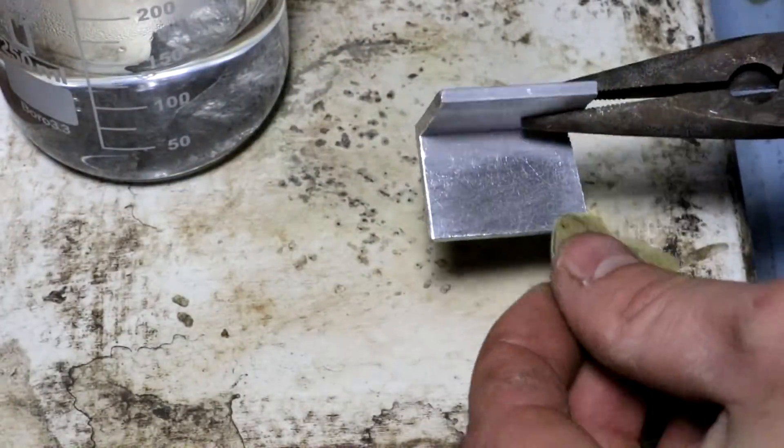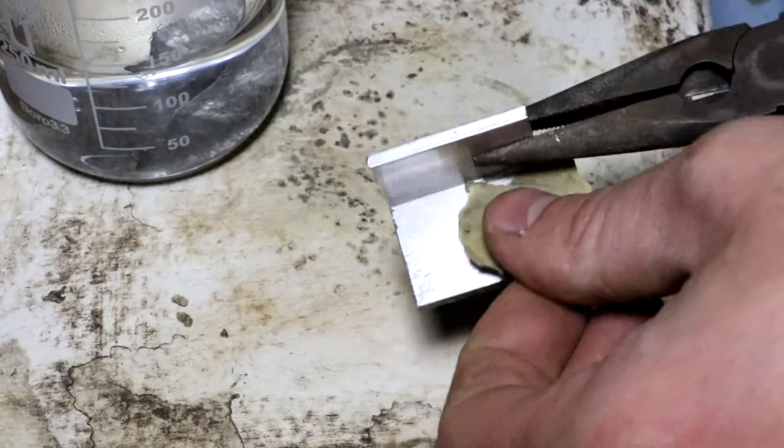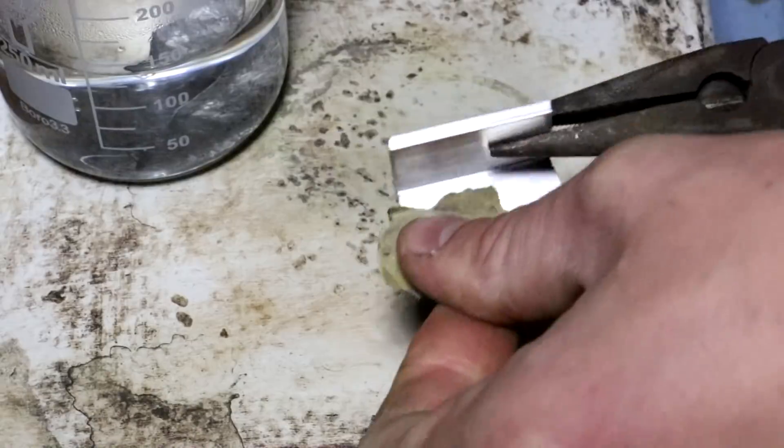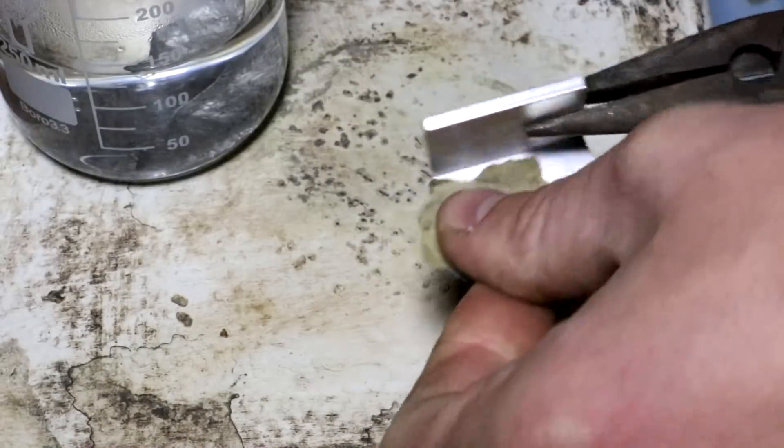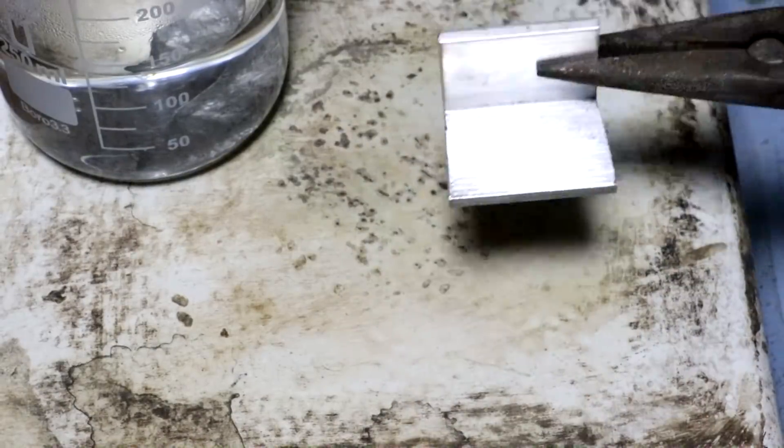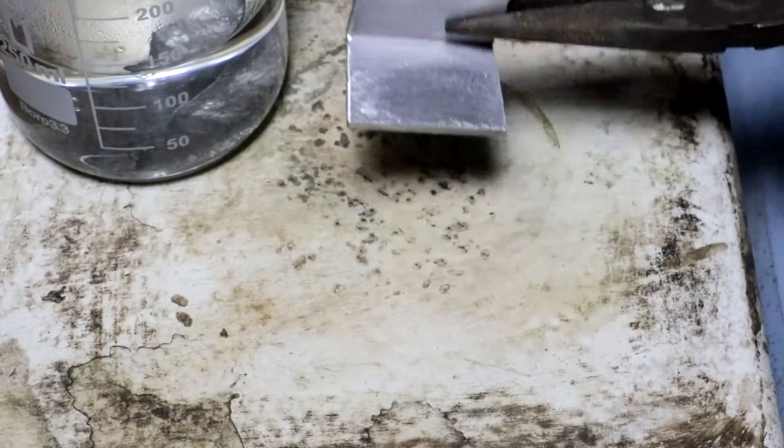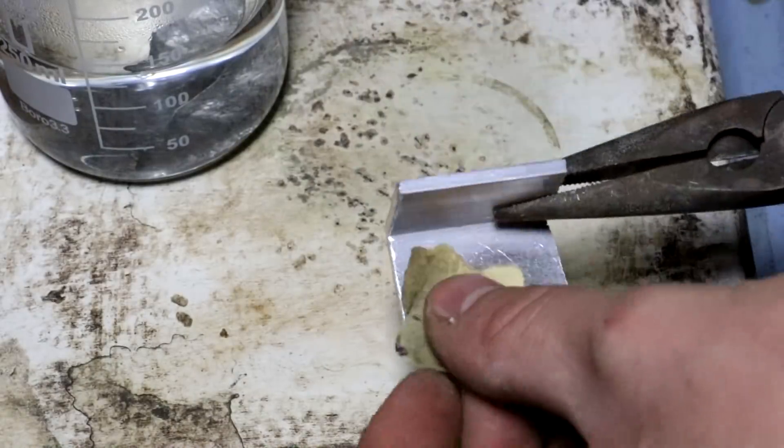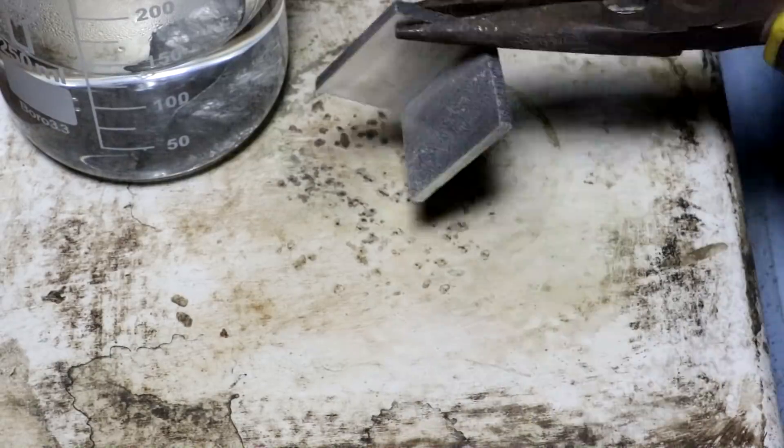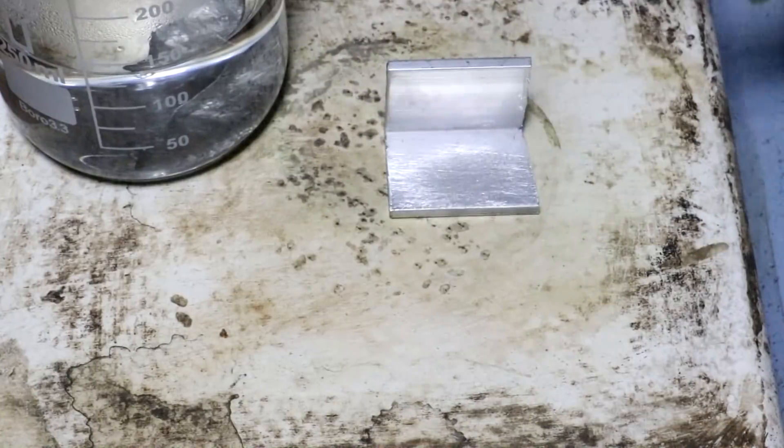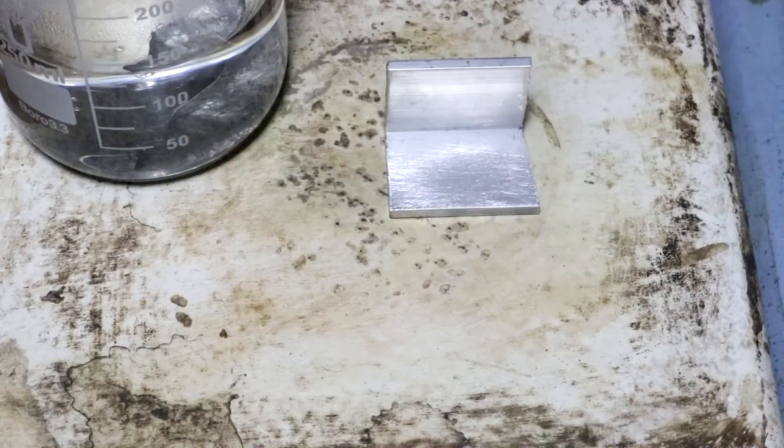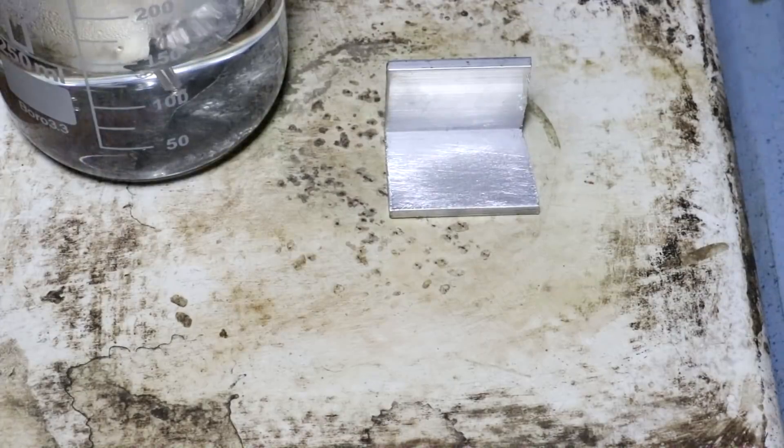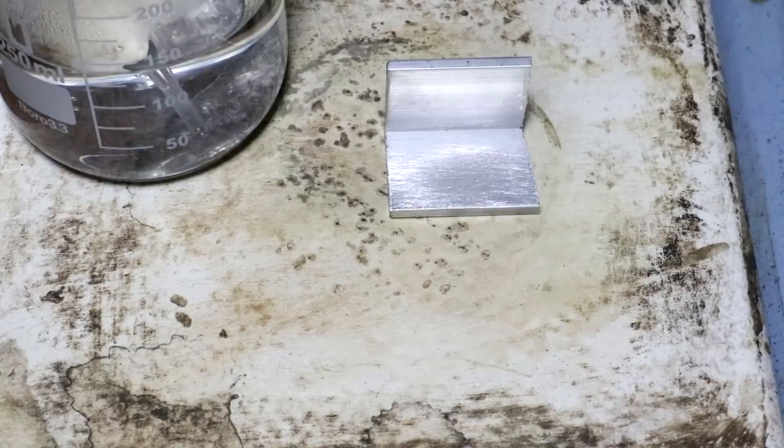As you can see, we've moved over to the hot plate. And right now, I'm just kind of scratching the aluminum to get rid of that oxide coating. If you've ever tried to react aluminum with another metal, you'll know that it's not exactly trivial. Aluminum forms that oxide coating, which is rather difficult to get through. But that should help. But of course, the coating forms almost immediately.